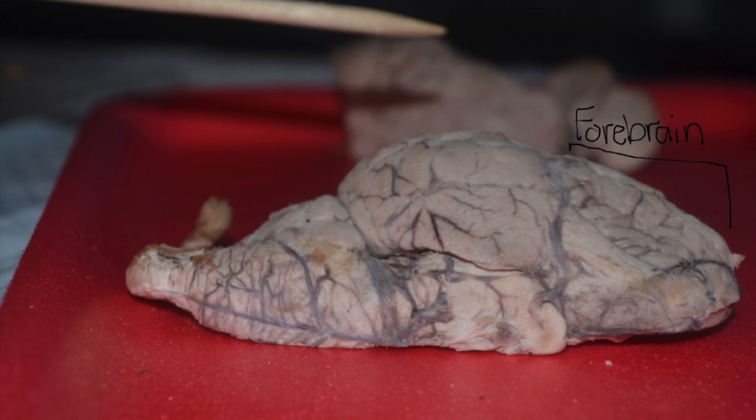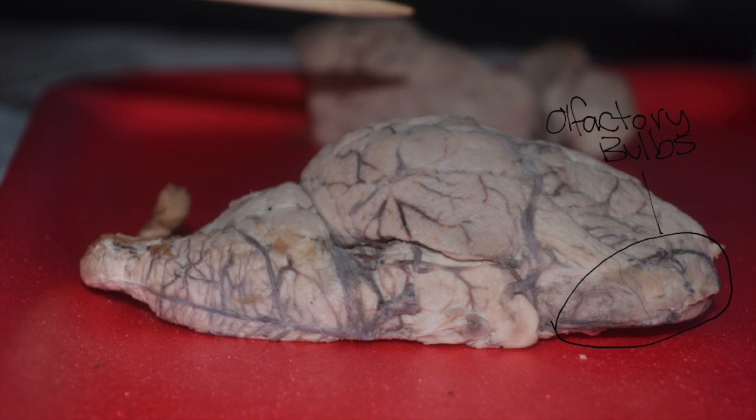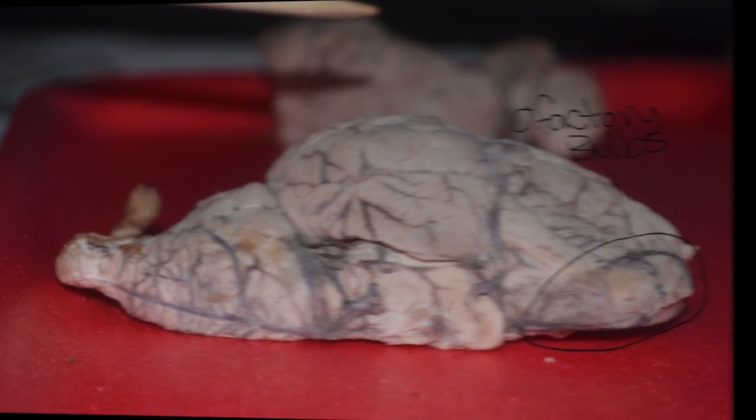The ventral surface is where the major nerves in your body, called cranial nerves, connect to the brain. Cranial nerves are a part of the system that helps you perceive the world through the five senses. The two white areas that are slightly lighter than the rest of the cerebrum are called the olfactory bulbs. This is where your brain processes what you smell. In sheep, the olfactory bulbs occupy more of the brain than in humans.